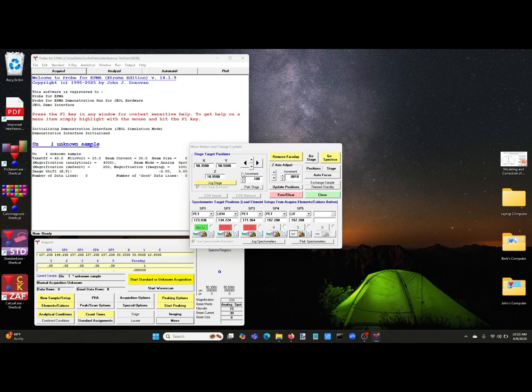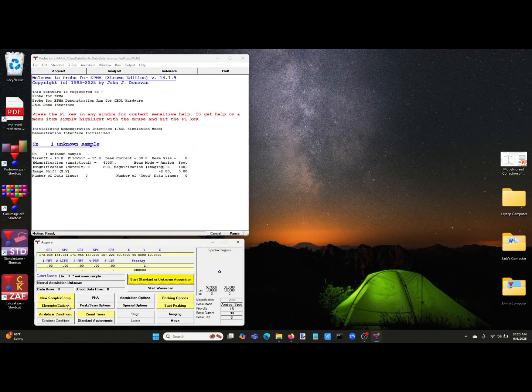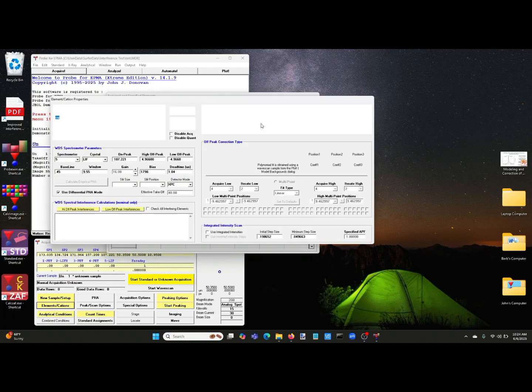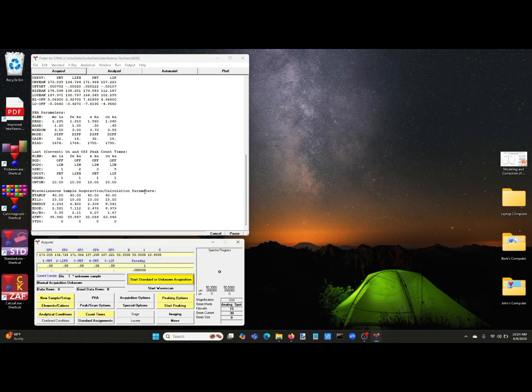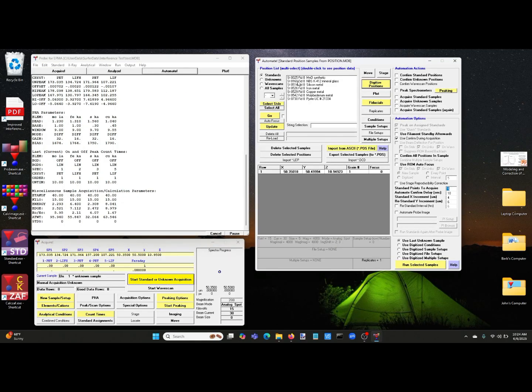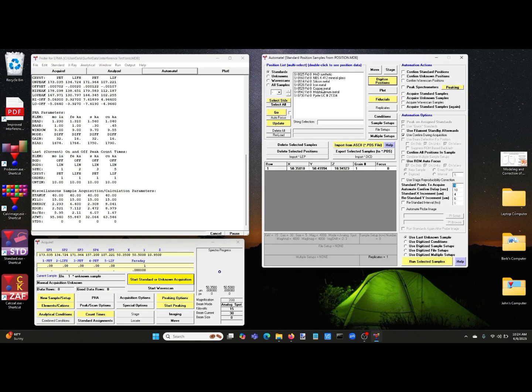So let's do that on the LIF crystal. And we move the spectrometer to those positions. You can see here. And when it's done, we close this. We go to elements cations, and we add these elements to our run in whatever order we prefer. We use default settings. This is just a test example. So now we have a sample that contains molybdenum, iron, sulfur, and copper, and of course other elements can be added in addition. We now go to our automate window where we manually acquire standards, and we'll want to acquire a standard for each of these elements.